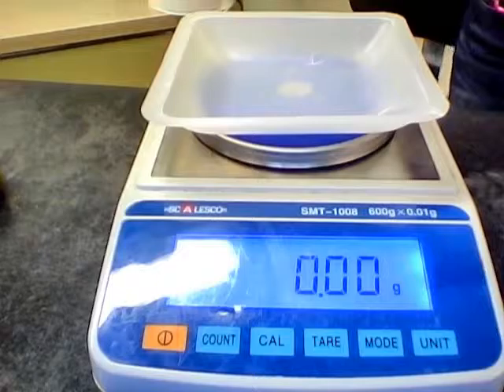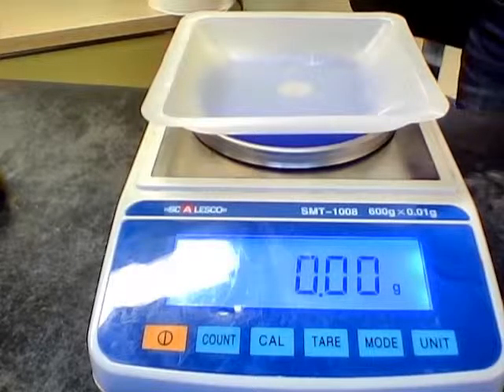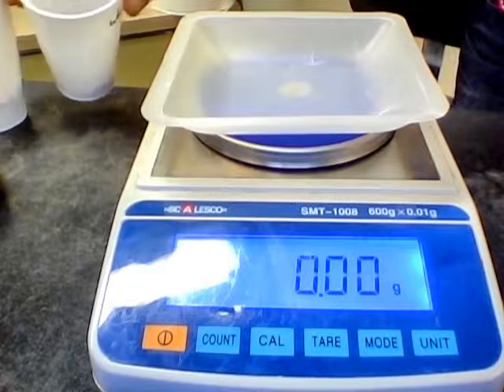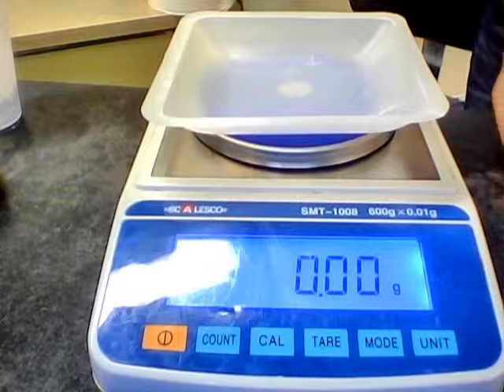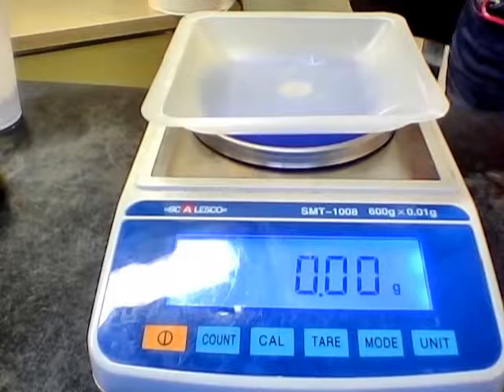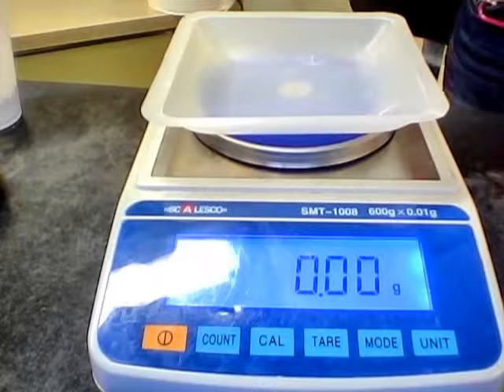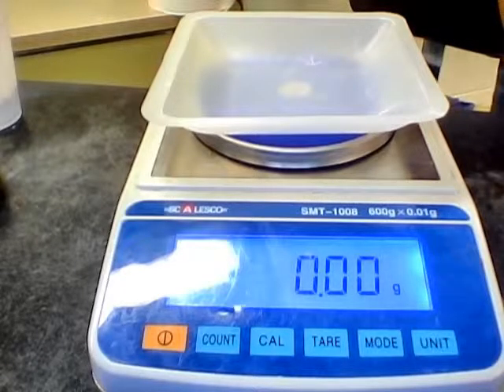So we're going to take samples of beans. I have equal numbers of beans in each of these cups. I've got white beans, black beans, lentil beans, and brown beans, as you can see from your worksheet. And I'm going to be measuring the masses of each of these bean types. Similar to what scientists did in defining the mole, they took equal amounts of atoms. How exactly they figured out that they had equal amounts, that's a topic for another day, but they took equal amounts of atoms, and then they did something similar to what we're about to do.